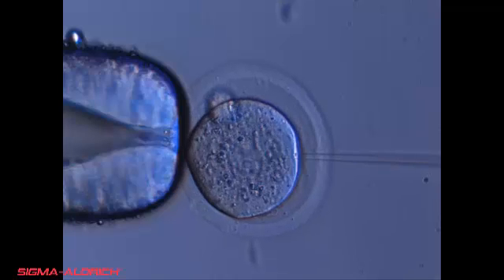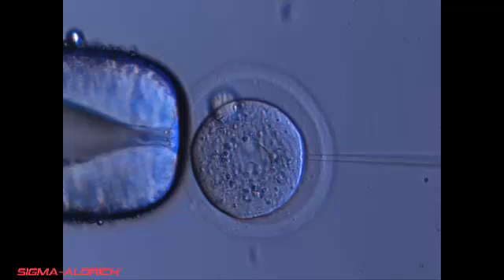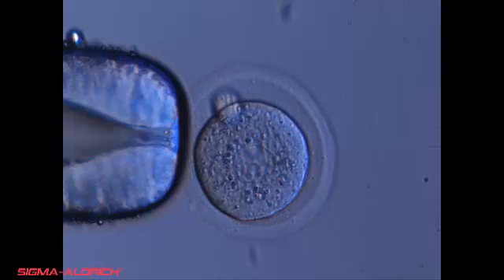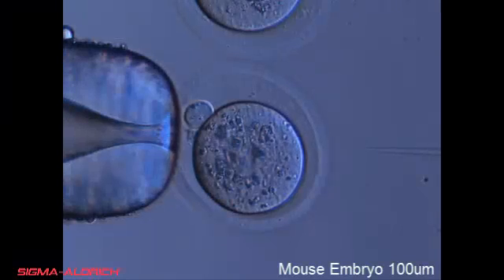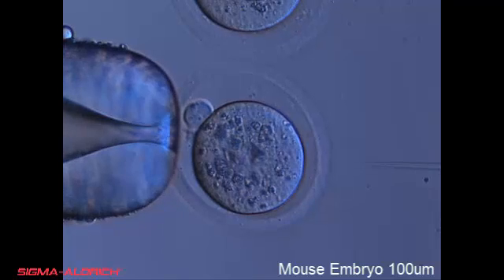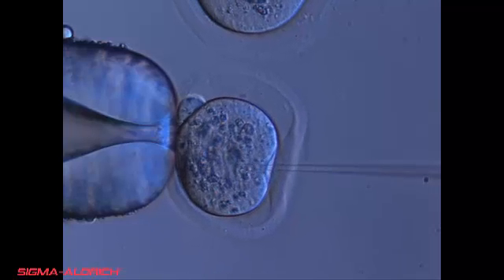Once the pronuclear membrane is pierced, expel the injection solution into the pronucleus. A 10% swelling of the pronucleus should be observed, and the pronuclear membrane will become much more defined. Carefully remove the needle out of the embryo. Pronuclear injection is usually performed on the male pronucleus because of its larger size. However, if the male pronucleus is in a difficult spot, then the female pronucleus can be injected successfully.